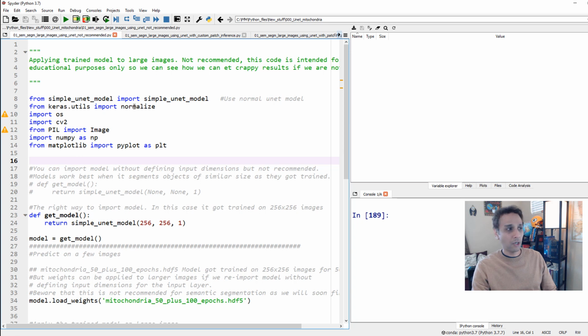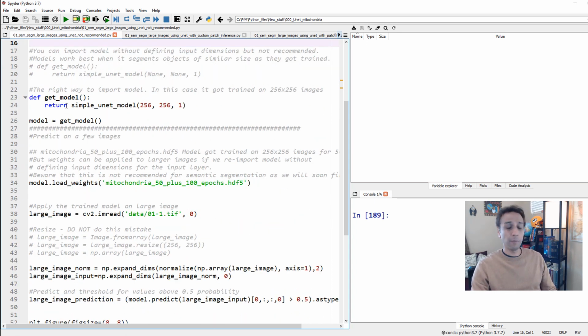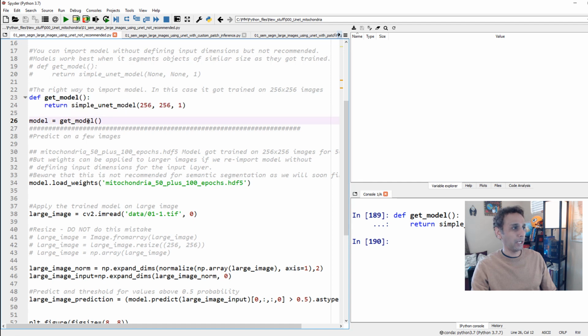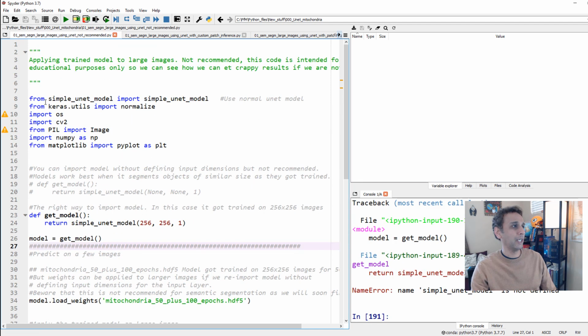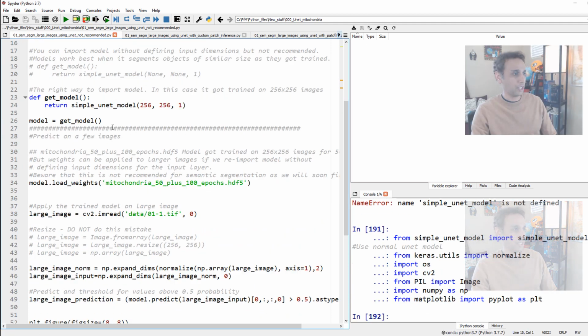We are going to normalize our inputs, and use OpenCV for reading images, and Pillow if we want to resize an image. We'll see that in a minute, and Matplotlib for plotting. Okay, so far so good. Now, let's go ahead and import our model and corresponding weights. Okay, so I'm going to get the model and then define my model equals to get the model, right? So now my model is defined. Well, simple. I should have run these lines first, obviously. Import the libraries, not just talk about it.